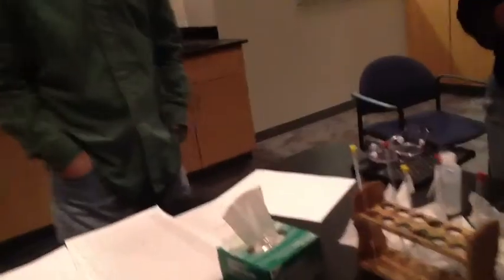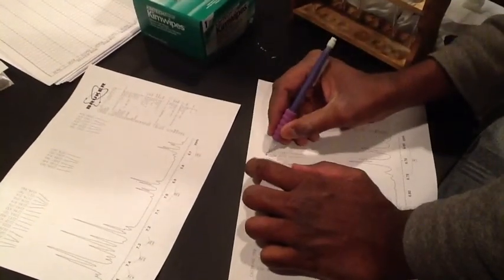All right. And you said something about average? Yes, I need your printout. You can rinse this with acetone, and the liquid should go to the solvent waste. Okay. So this is all your peaks. Those are phenyl peaks. These two peaks are the protons on the double bond, right? And these two peaks I gave the expansion. So if you see these two splittings, right?